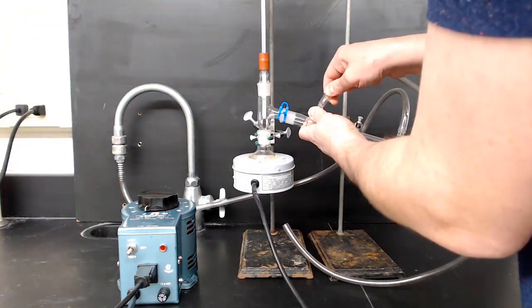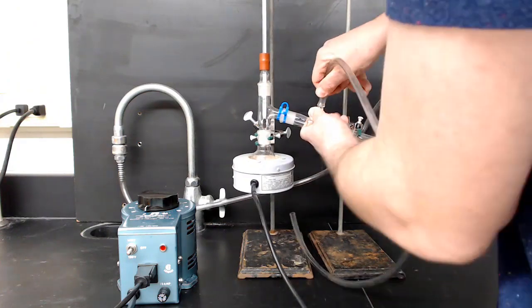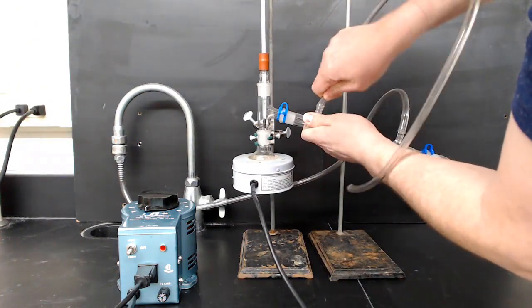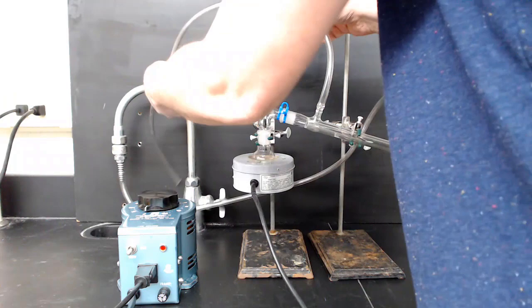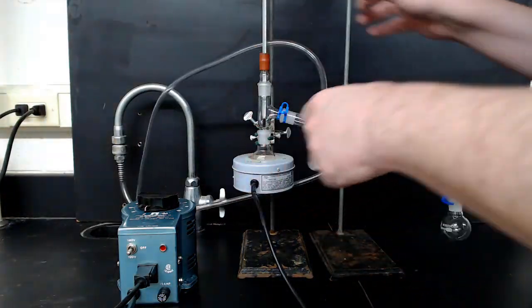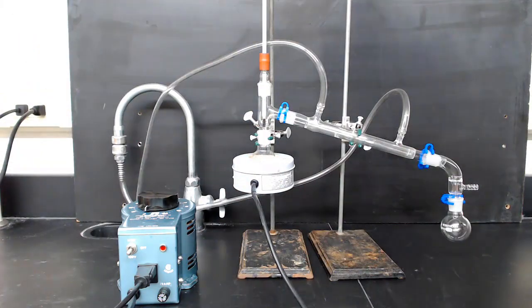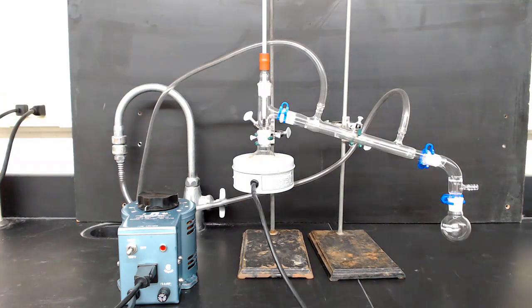Next, get another piece of hose and attach that to the top hose barb. The other end of the hose goes to the cup sink. The idea here is that water is going to go in through the condenser through the bottom and out through the top. This arrangement is important because it will allow air bubbles to escape out the top of the condenser. If you get it hooked up backwards, you'll notice that the condenser doesn't stay full of water very well.